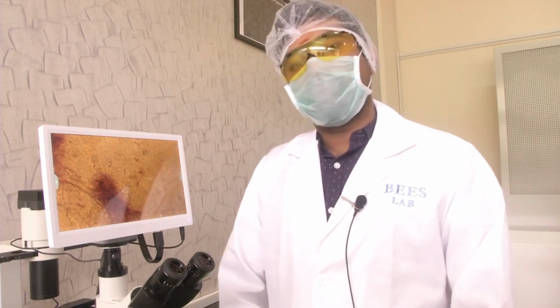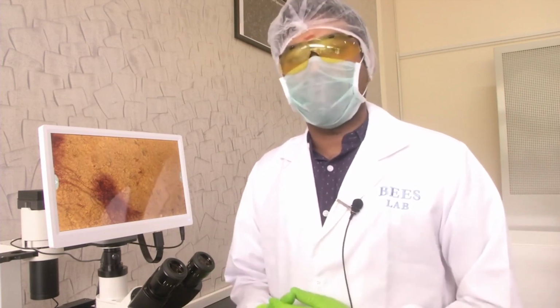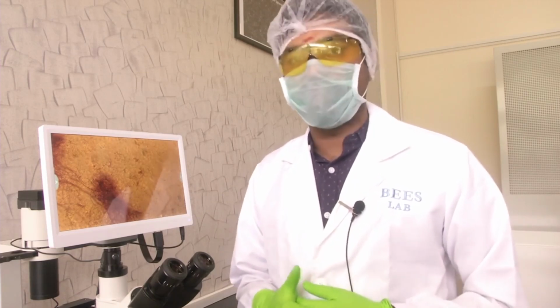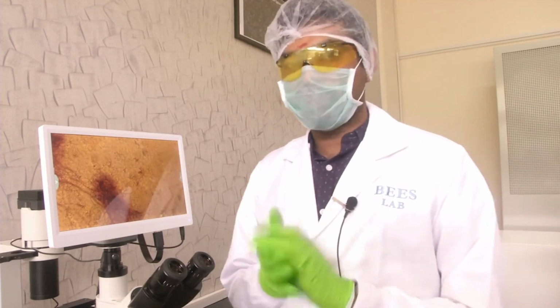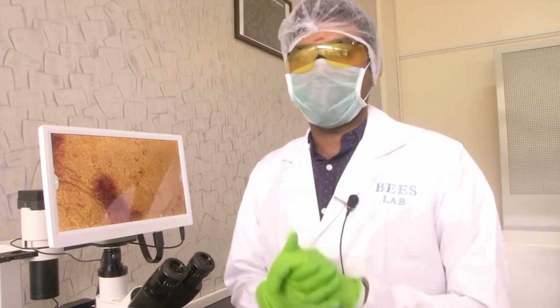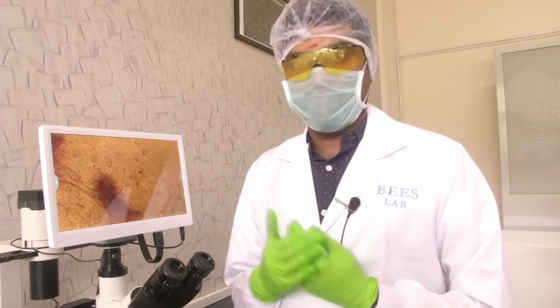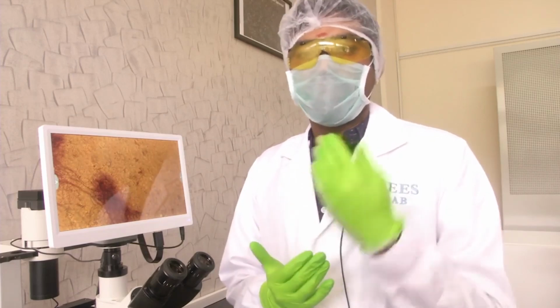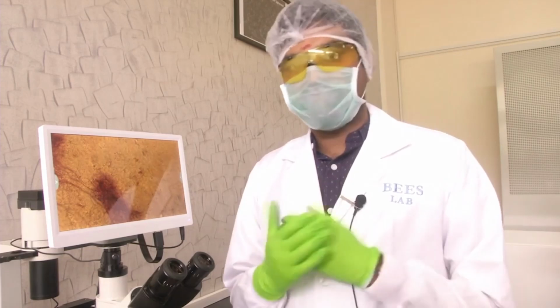In the previous few modules, we have introduced you to microscopy in general. We have told you what is optical microscopy, what is electron microscopy, and showed you why an optical microscope would be used in a typical lab setup, and why electron microscopy is a much more specialized requirement that would need a dedicated facility.